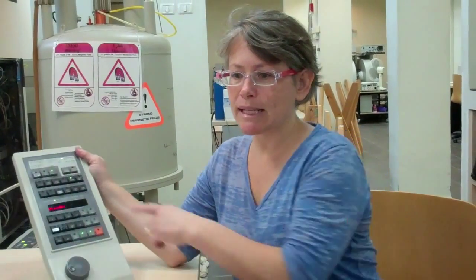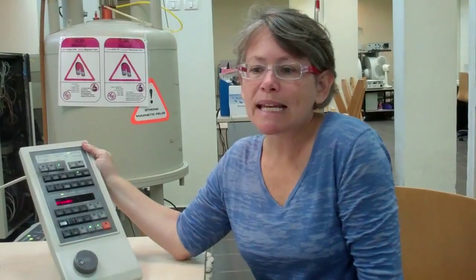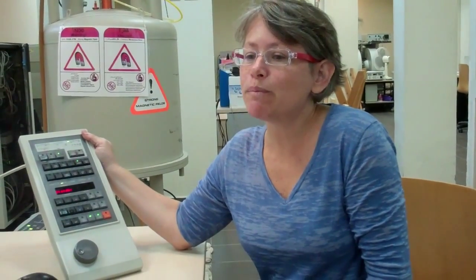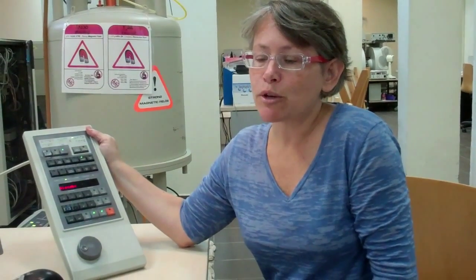Did you notice the spin button light? It was blinking and then it stopped blinking. The blinking light tells us that the spin button was activated, but the measured spin rate differed from what we requested by more than plus or minus 1 hertz.